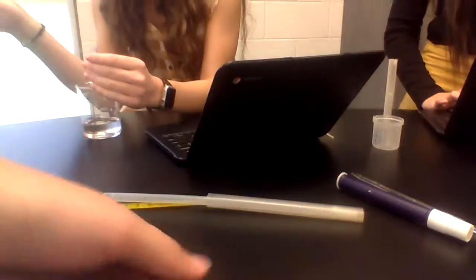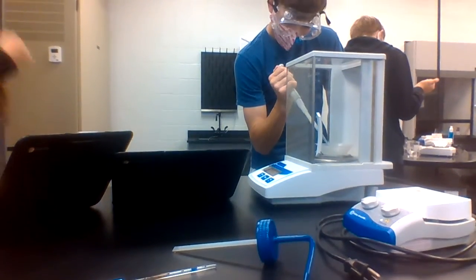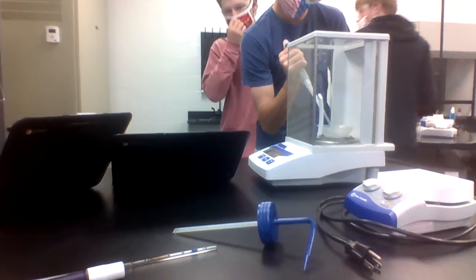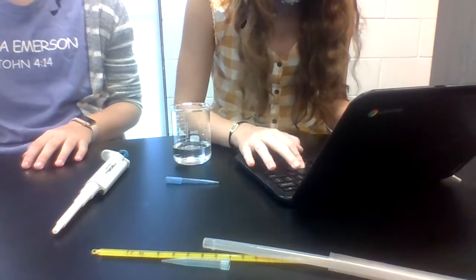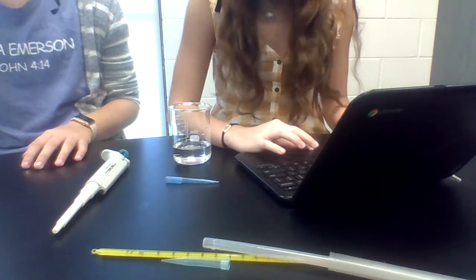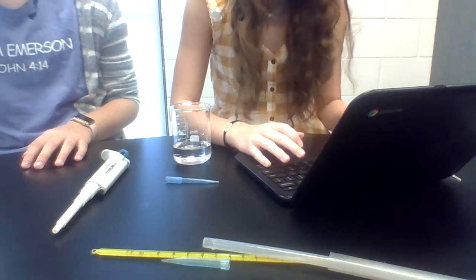You forgot the video of the other one. They shouldn't be drastically different. Oh, so we forgot the video. We got right at it. Remember, each time on these volumes, we were going for 3 milliliters. It was right at it. And now we got 3.02 milliliters.